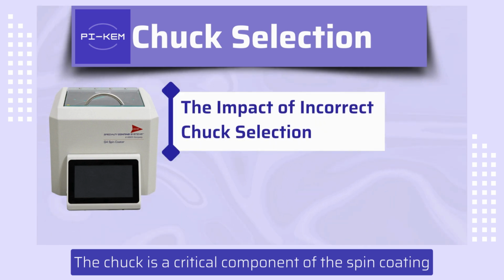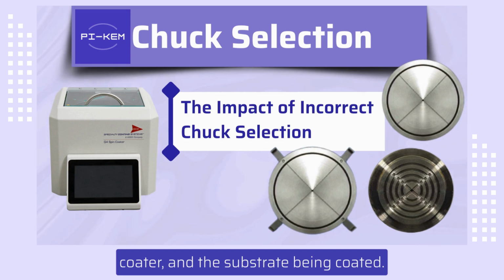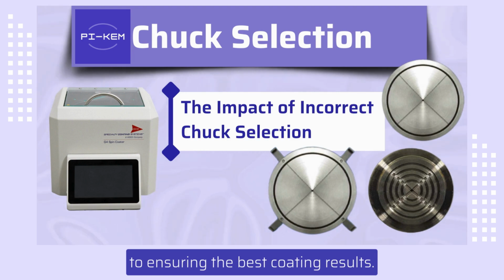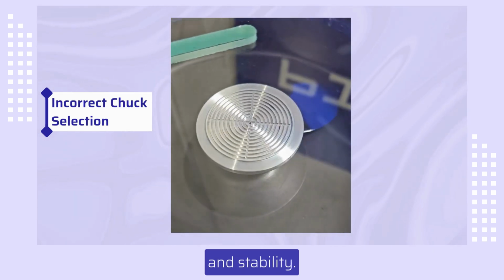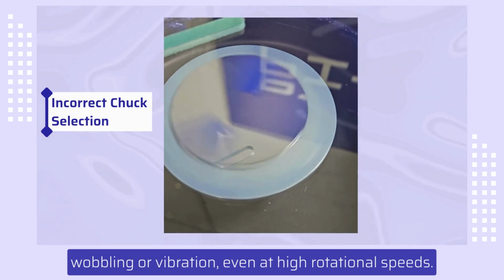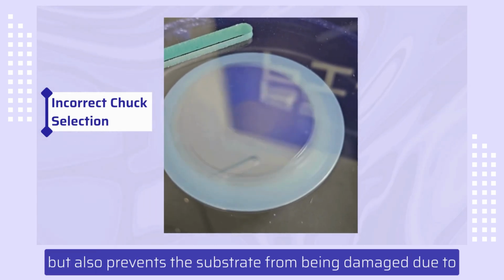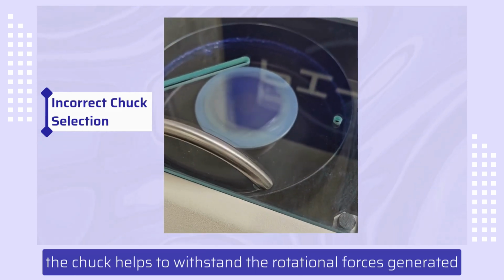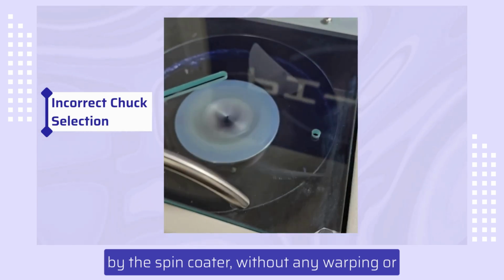The chuck is a critical component of the spin coating process, providing the interface between the spin coater and the substrate being coated. Selecting the correct chuck for each substrate is vital to ensuring the best coating results. Selecting the correct chuck is vital for substrate security and stability. The chuck firmly holds the substrate in place without any wobbling or vibration, even at high rotational speeds. This prevents defects in the coating film, but also prevents the substrate from being damaged due to becoming loose during the coating process. Furthermore, the chuck helps to withstand the rotational forces generated by the spin coater without any warping or breaking of the substrate.